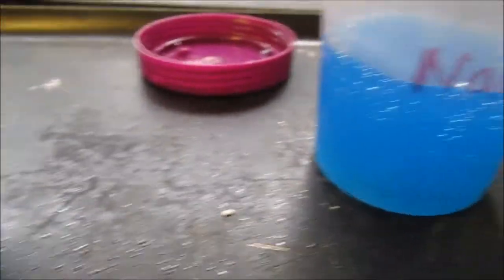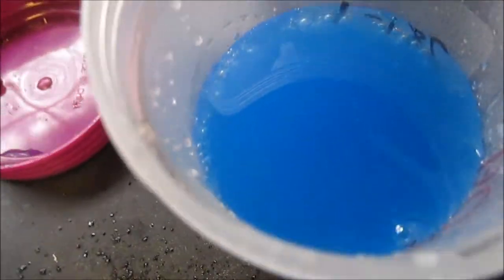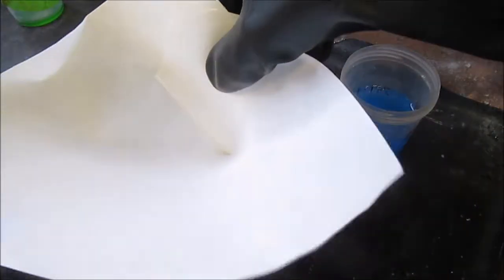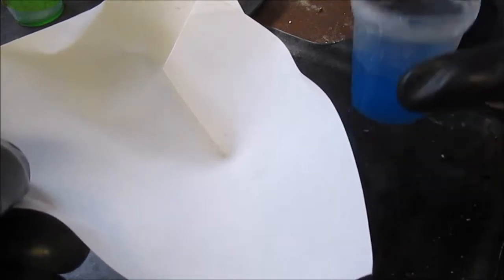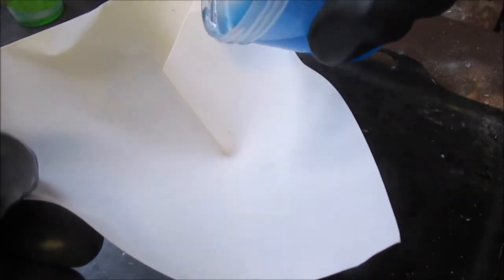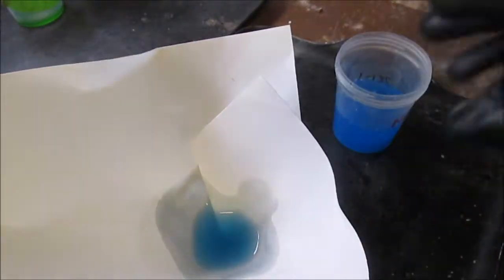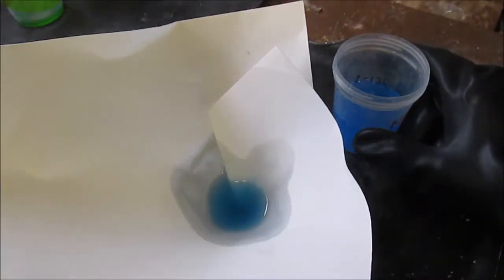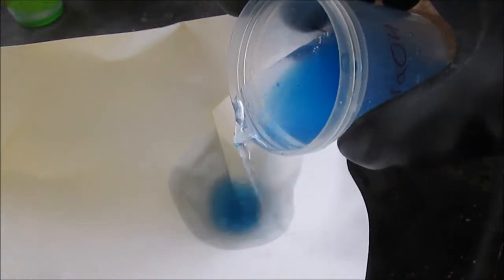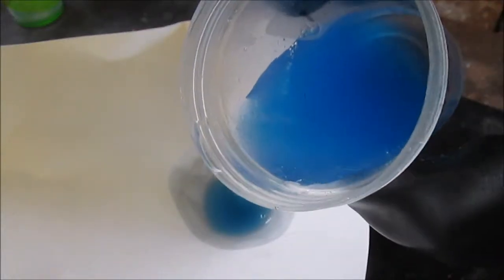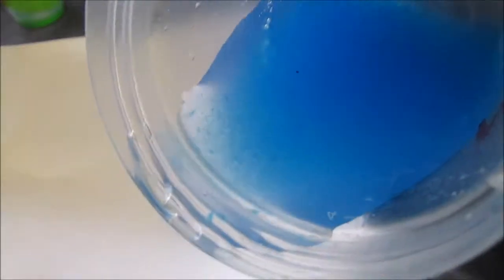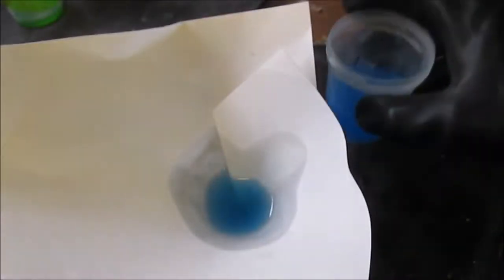Notice the difference in clarity. This is a very intense blue. Okay, now I just want to filter my remaining excess copper sulfate out. And that one will go right inside my cup. And I'll just pour away. It's mostly clear color, and it actually is more of a suspension of copper hydroxide that causes it to look blue.